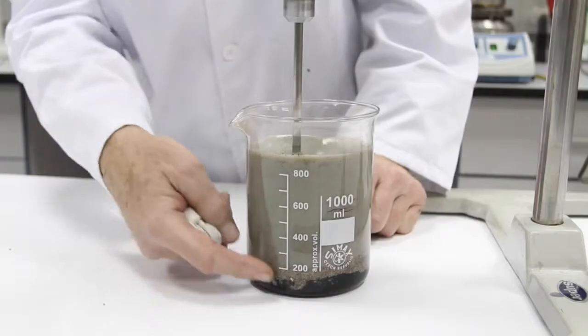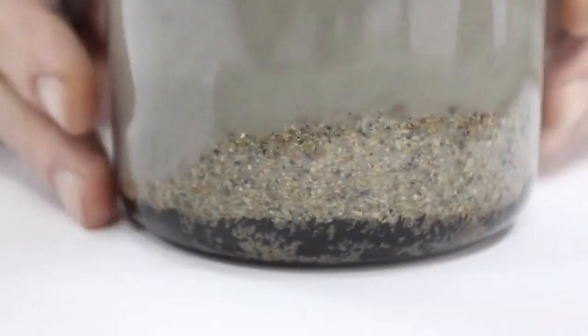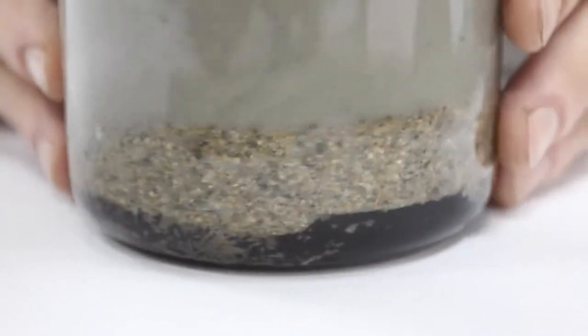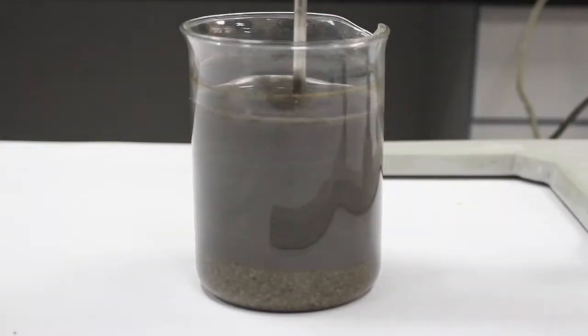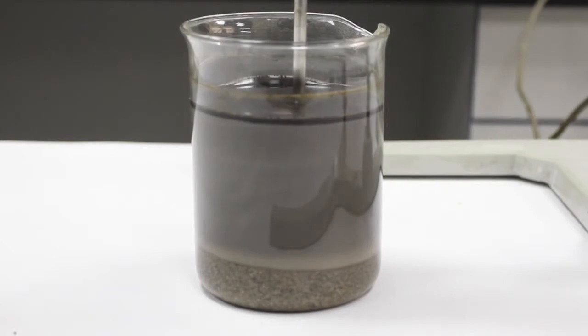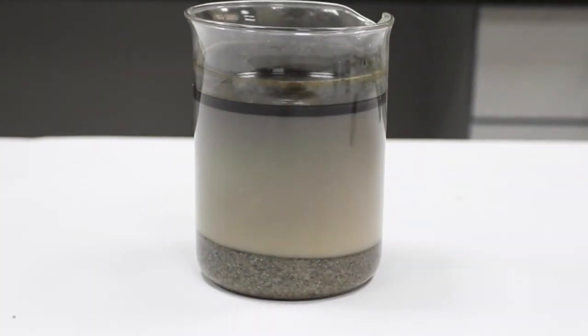It can be observed that the impregnation of the crude oil on the beaker walls is diluting into the emulsion until it disappears completely. At the same time, we see that the sand is already moving freely in the emulsion because the crude oil has detached and emulsified with the clean water. The stirrer is removed and left to stand for 5 minutes.